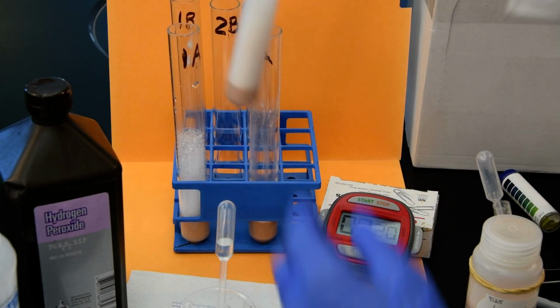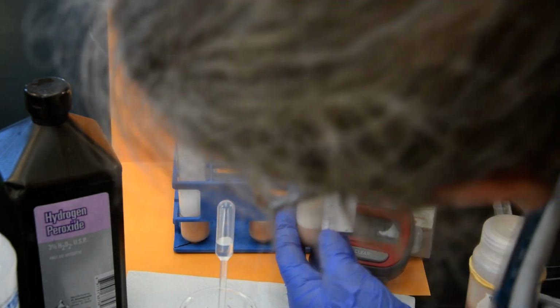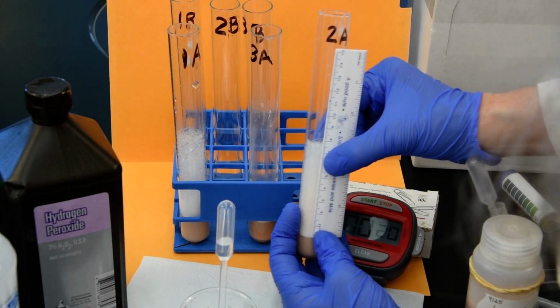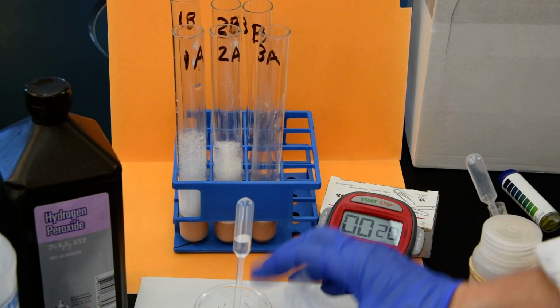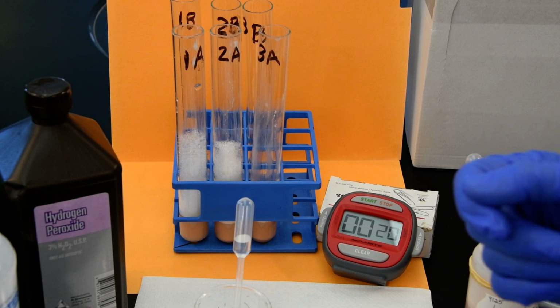All right, so everybody's a critic. In test tube 2A, which had twice as much, we only got about 7.8 for the bubble. My students always tell me that too. So about 7.8. All right, let's try this last one then. So really negligible difference between the two.